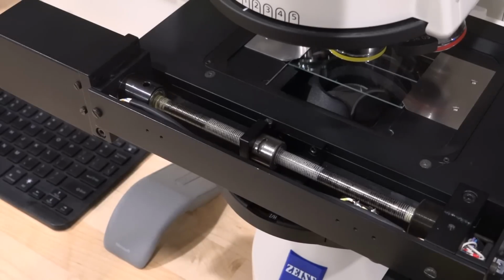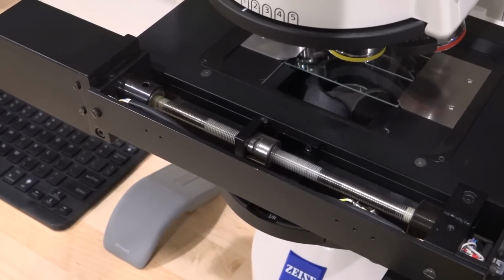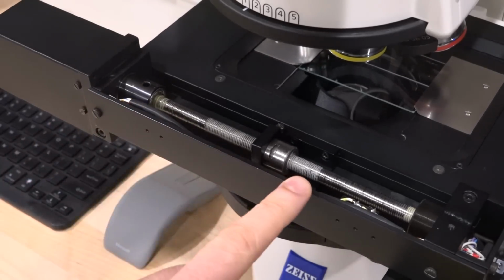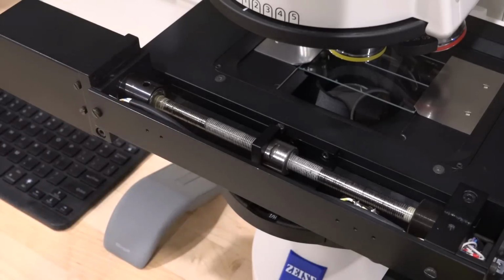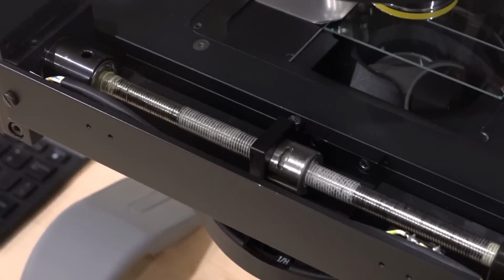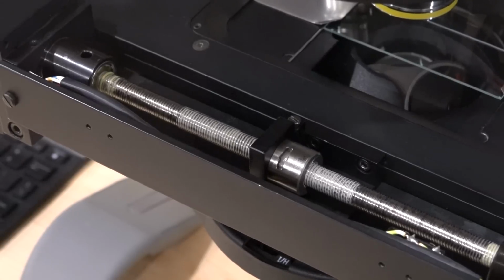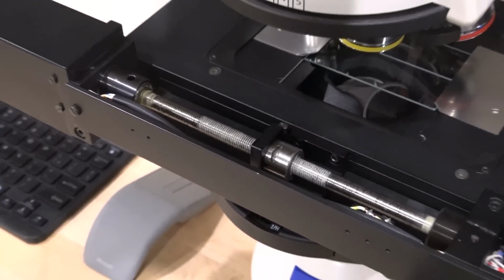So it's a lot of very precise measurement and, of course, mechanics. Now, if I move it left and right, you can see how it moves. There's also two limit switches in here, which you can move around, but you can also set software limits, so it can't go beyond a certain amount and damage itself. If I zoom in a little bit more and use the fine movement, you can kind of see it move around using the optical encoder. So the movement is really, really accurate. It's very satisfying to move this around because it works so smoothly.